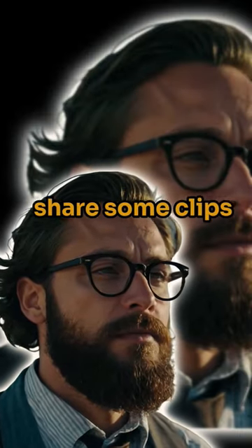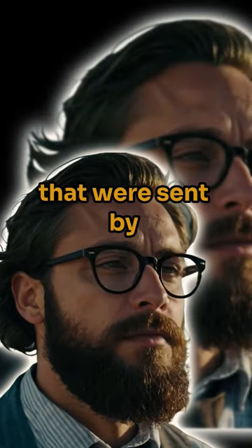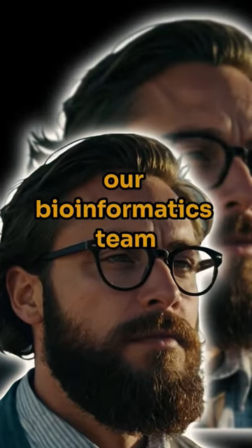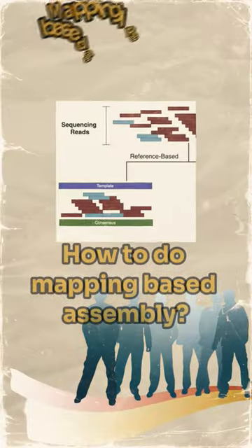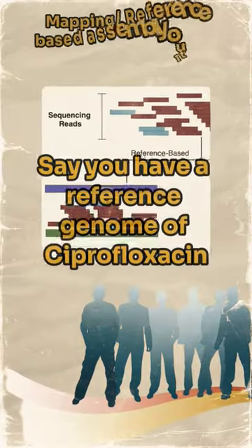Right now, I'm excited to share some clips that were sent by our bioinformatics team. Enjoy! How to do mapping-based assembly?